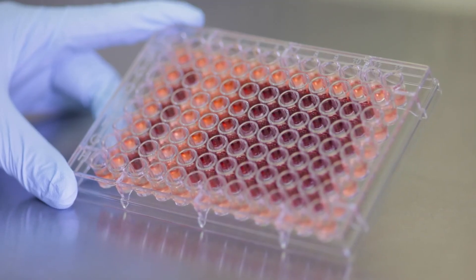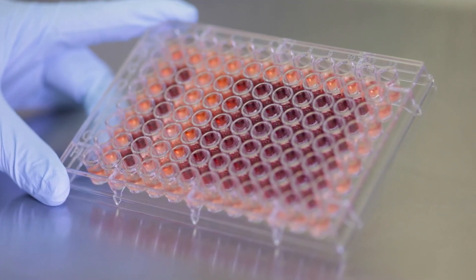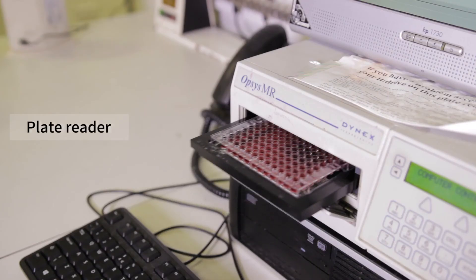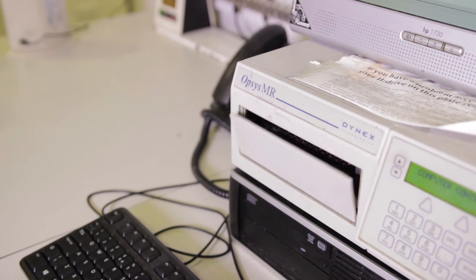The plate is ready now. As you can see, the color of the media has changed. Some wells are darker than others. That means they have more live cells. I will now use the plate reader to measure the absorbance and quantitate the cell viability following the treatments.